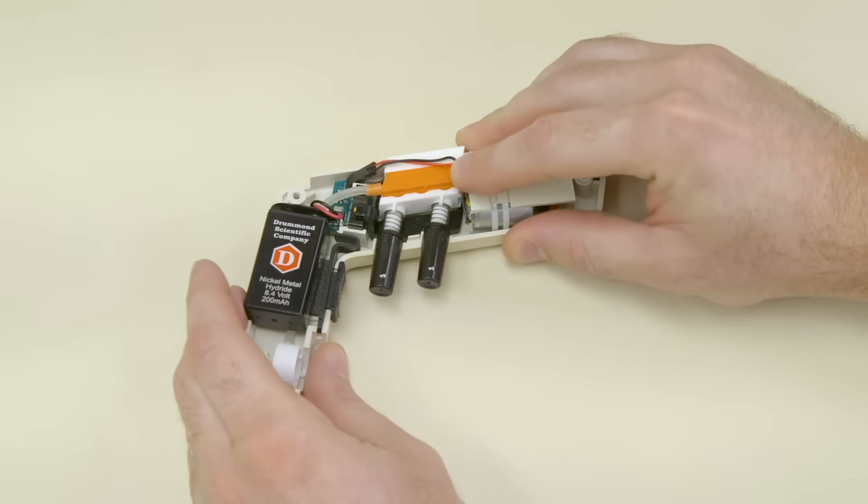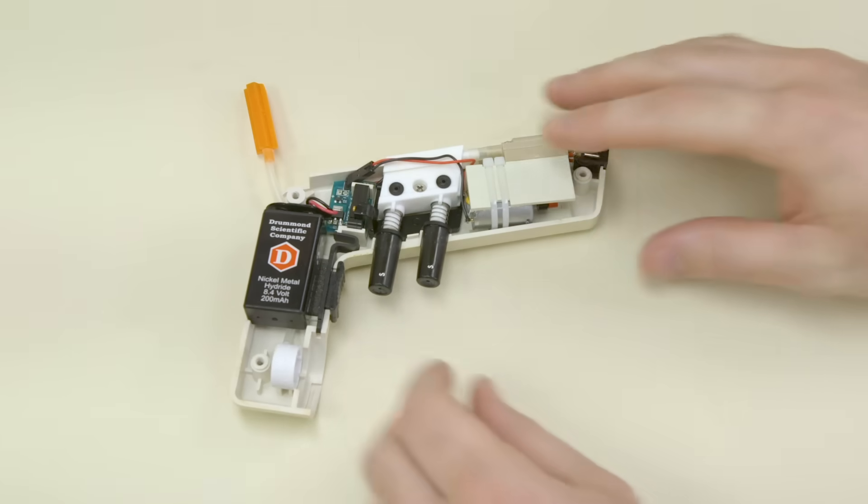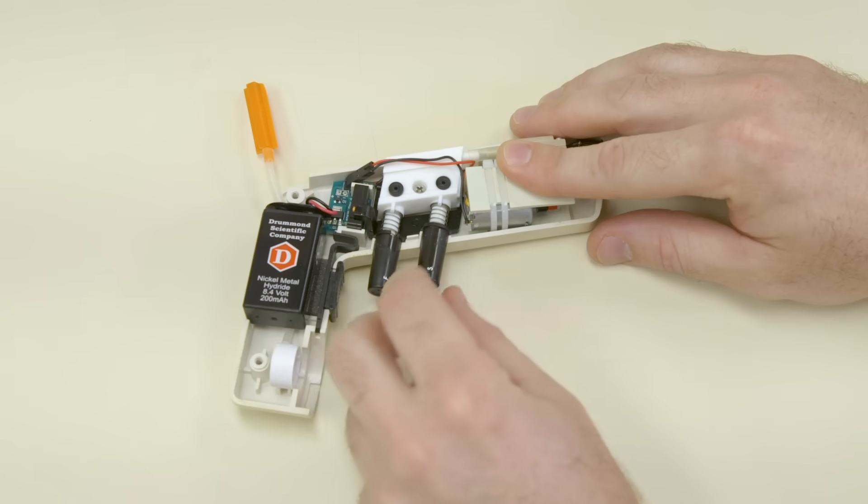Slide the yellow or orange valve body cover to expose the O-rings. Rotate each button, which will raise the O-rings, making for easy removal.